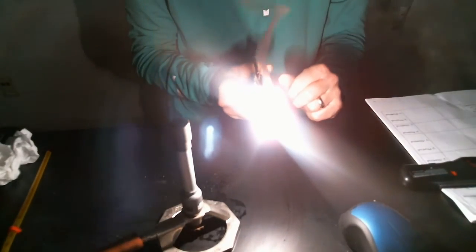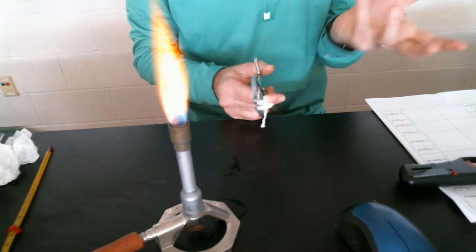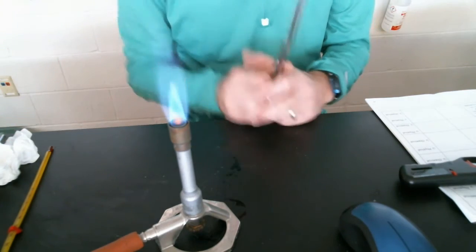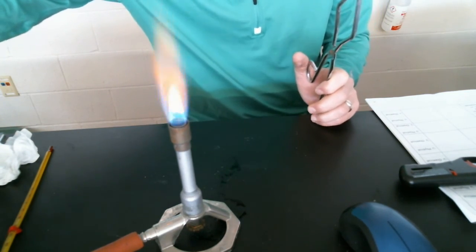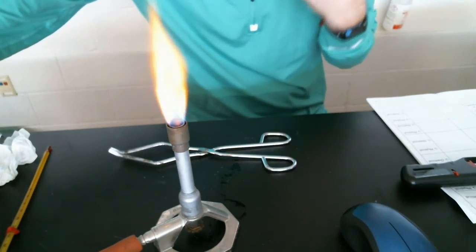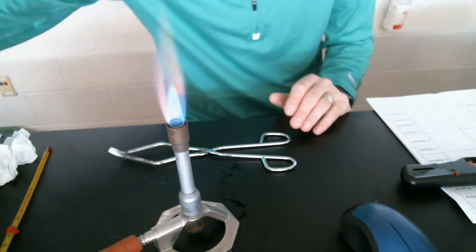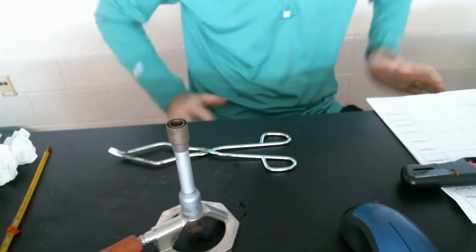I'm not staring at it directly, but we have some smoke being given off, a whole lot of light being given off. So what do we think? If you selected chemical, that would be correct. Magnesium, once we used our Bunsen burner to give it that little bit of activation energy, reacted with oxygen in the air to make magnesium oxide. That would have been a chemical change.